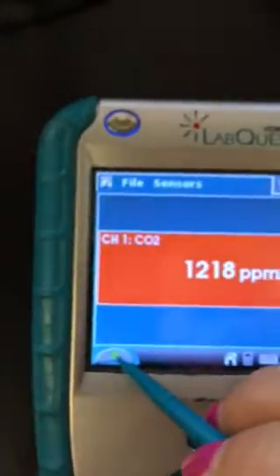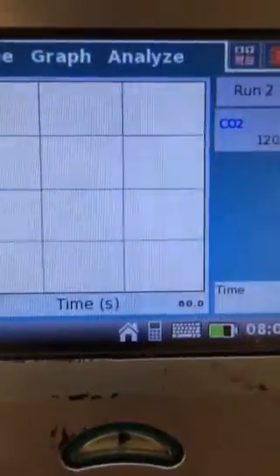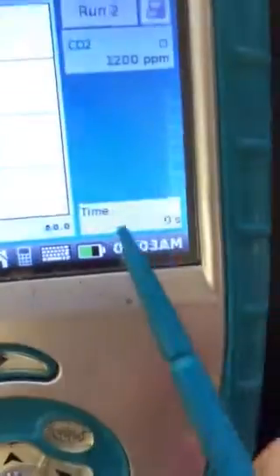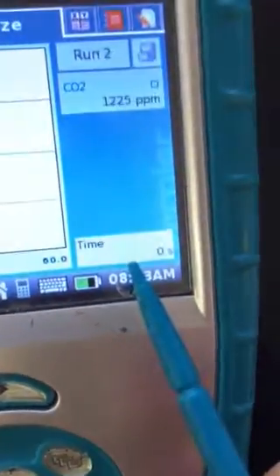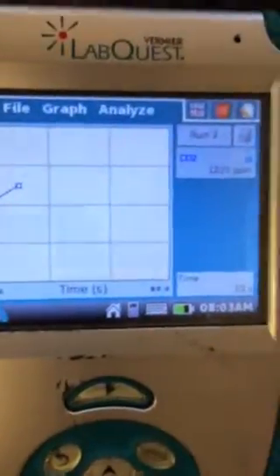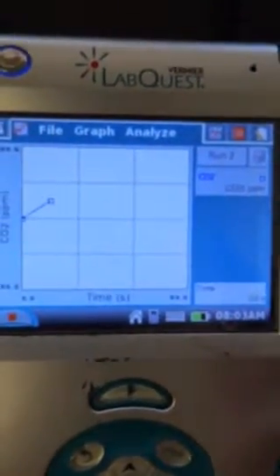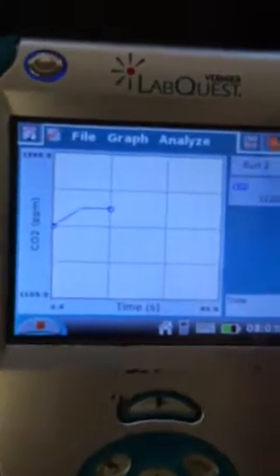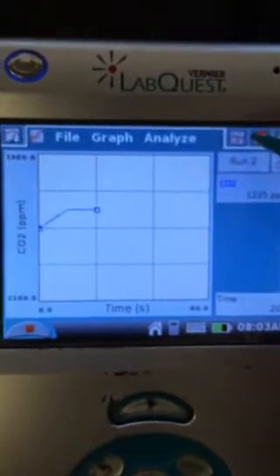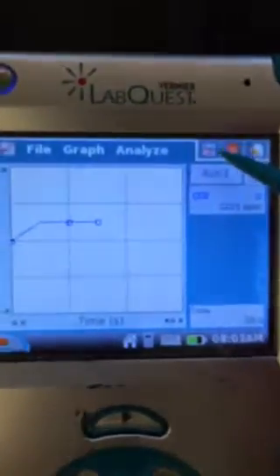Now when I press play, I can just let it run, and it'll run for 60 seconds, as it says right here, and it'll go every 10 seconds and give me the measurement. This is really accurate because it allows me to come up with a true value instead of just eyeballing it, a true value for where the CO2 parts per million concentration is normalizing. While we wait for this graph to be made, where can you actually find the data points?